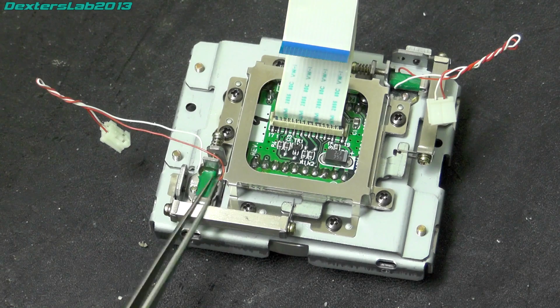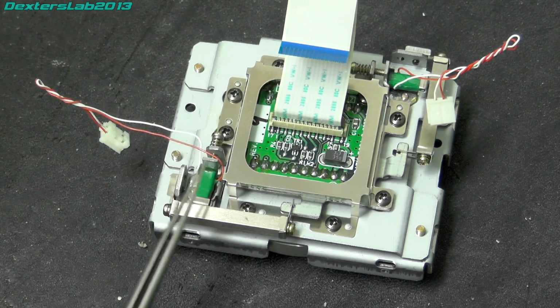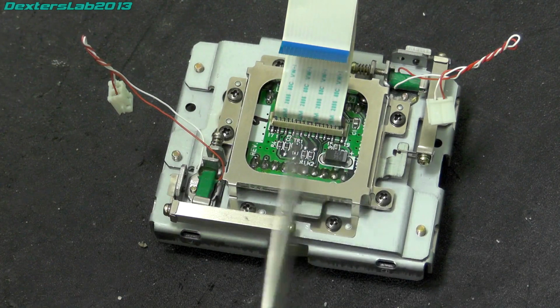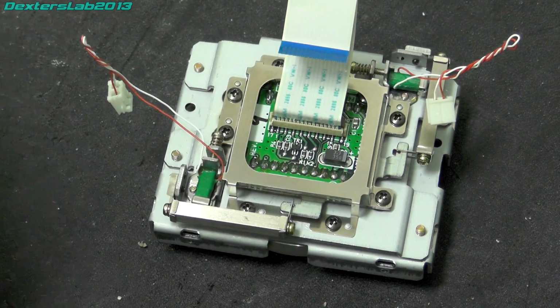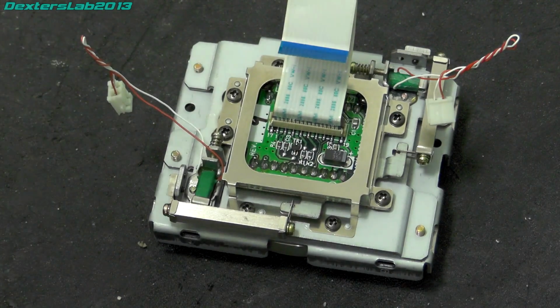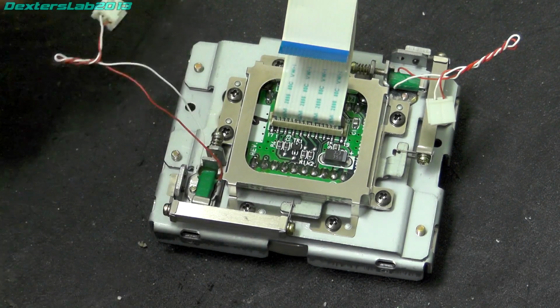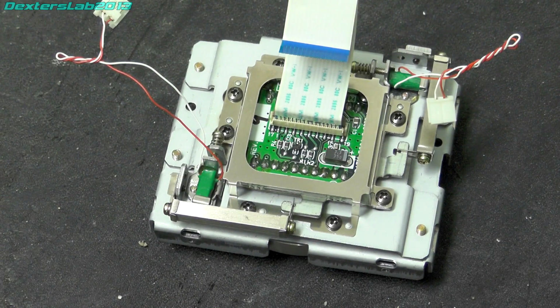Now I've just had to think about whether I actually want to pull these bits apart to find out exactly what these are. Some of the marketing material does say that they're piezoelectric, which is a distinct possibility, but without destroying it I won't be able to find out really. Actually, if I measure the DC resistance, that might give me a clue. Right, just looking at the DC resistance, it was in the range of mega ohms and then just went up and then off scale. So that probably does indicate that those are piezoelectric.